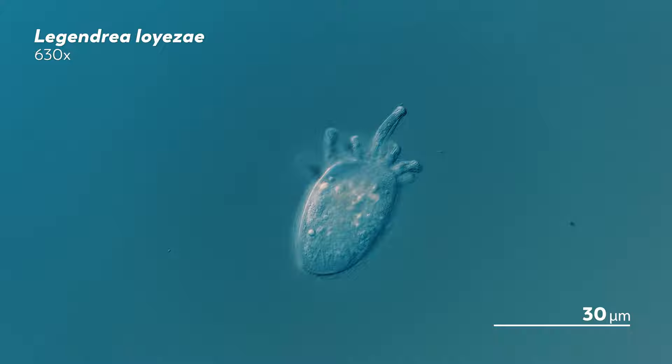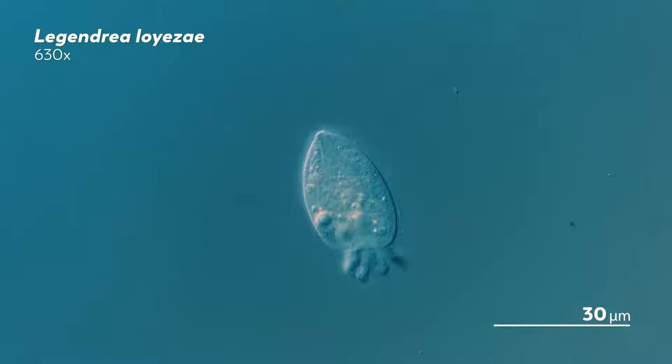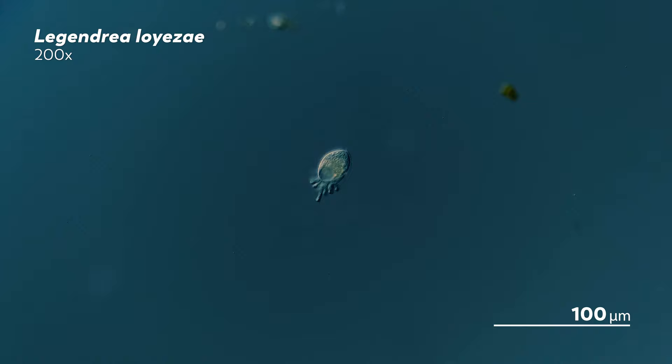The goal is to get that ciliate very, very clean. James sometimes has to leave them swimming for as long as 30 minutes in that drop of water. And that's not just to scrub their outsides — the insides need to be empty of any ciliates they might have eaten that are now taking up residence inside of a food vacuole. Yes, even a master of microscopes has to wait around a bit for a ciliate to poop sometimes. When he's done and the ciliates are all cleaned up, James freezes them in a tiny tube, getting them ready for the next step: isolating the DNA.